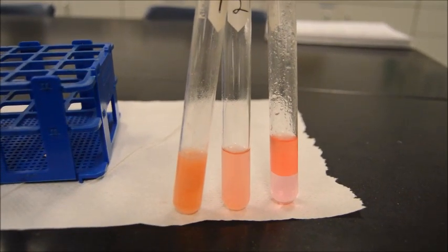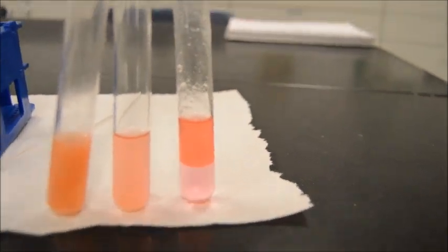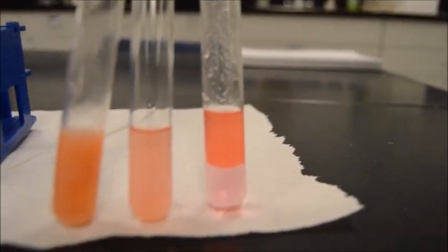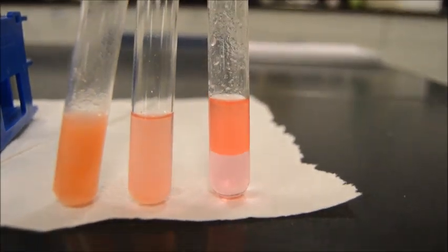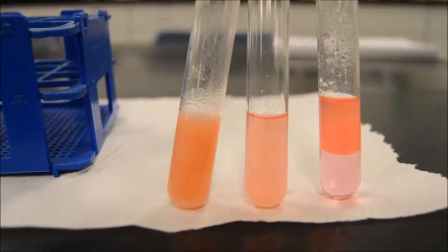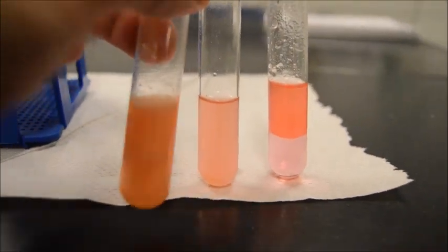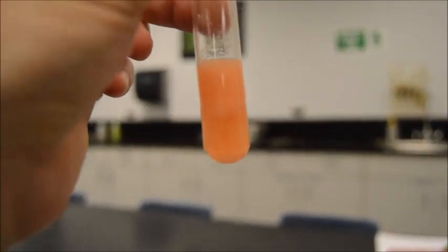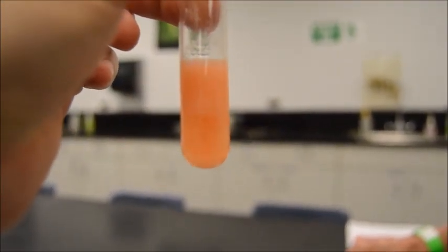Okay, folks, what we have here is the conclusion of our Sudan test. Now, this is our old Sudan that we did as a positive control a while back, and we held on to that for this very occasion. You can see it's a clear double layer here, whereas over here, these do not have a clear double layer. Now, this one, let me grab it from you. This one does have something happening in there.